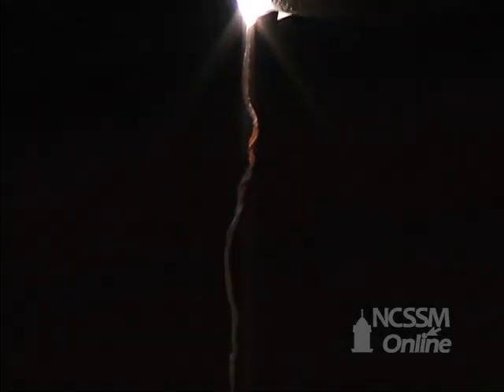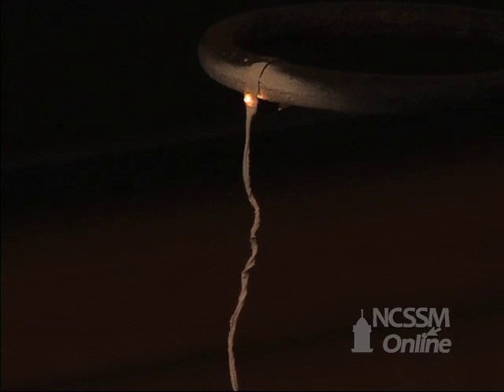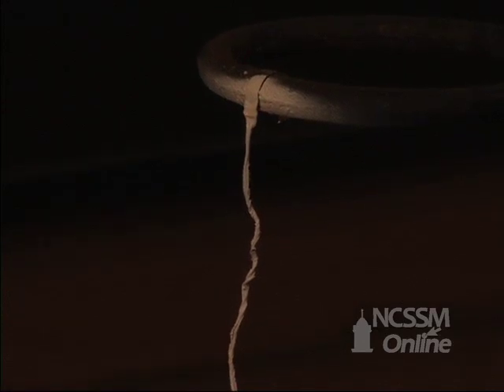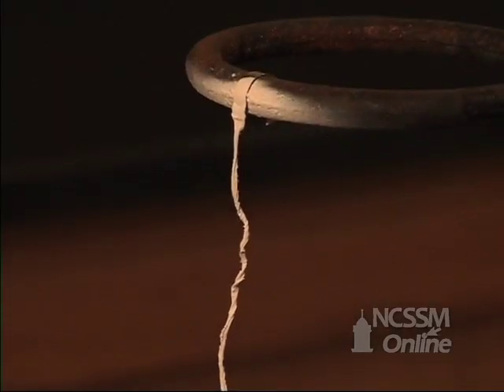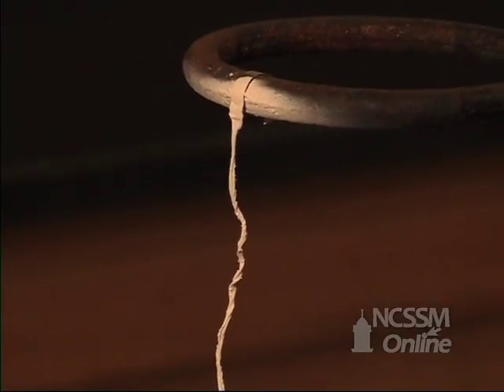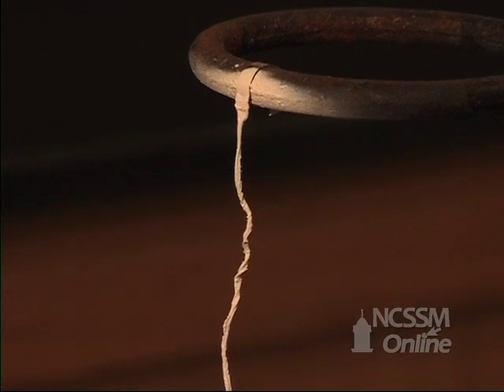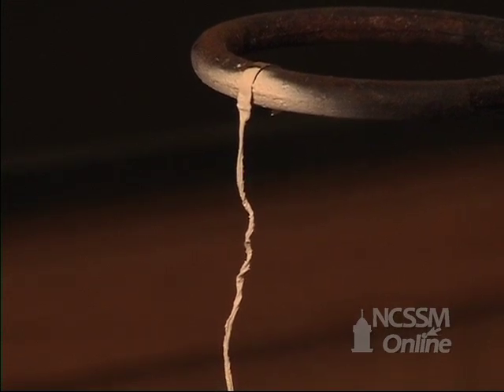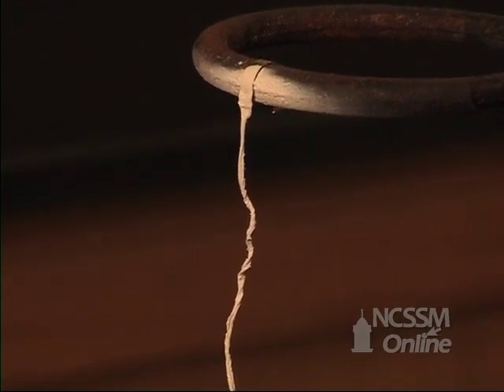The white smoke is actually very finely divided magnesium oxide. What we are left with is the ionic compound, magnesium oxide, which is a white solid.